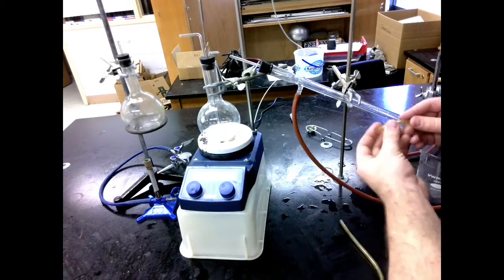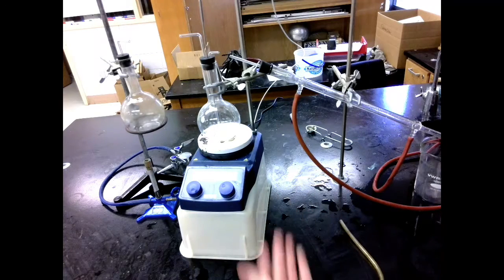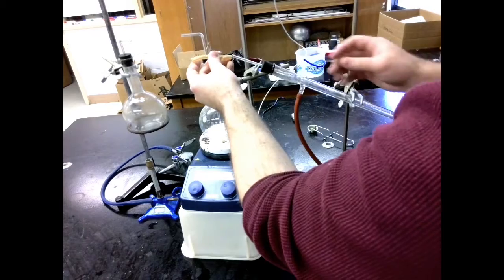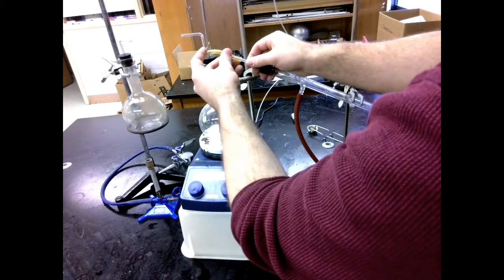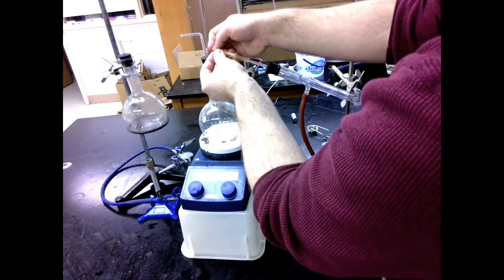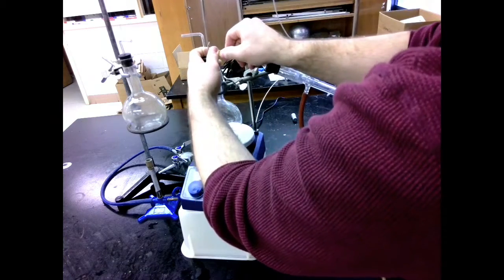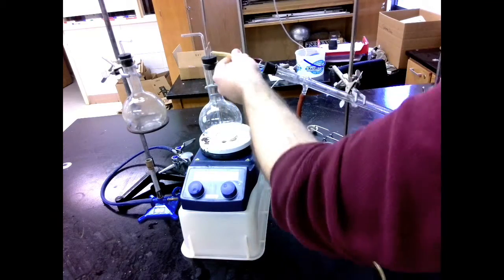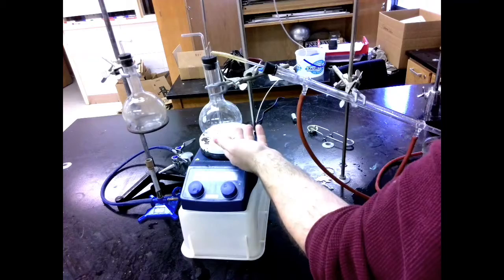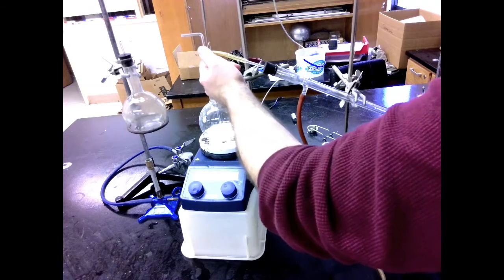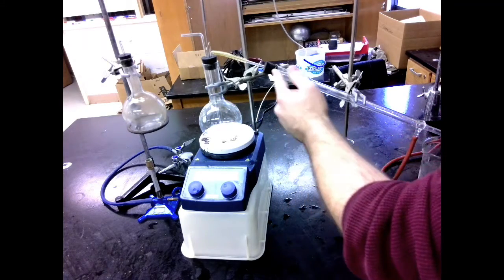So then once my heights are all good, next I need to put some rubber hoses on these. For these, I'm just going to use these little yellow rubber hoses. These will be the ones that fit onto the glass tubes nice and simply. They're in the cabinet with all the other tubing. You might need to cut one to a custom length. That's totally fine. When steam comes up through here, it'll go out through this shallow, the smaller of the two glass tubes. It will move out through here and into the condenser.